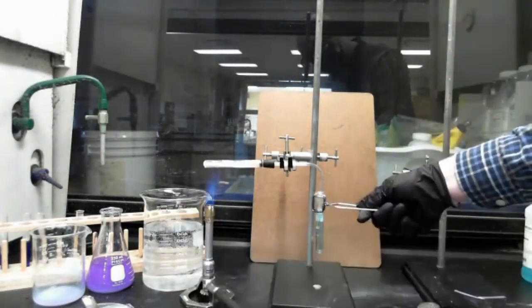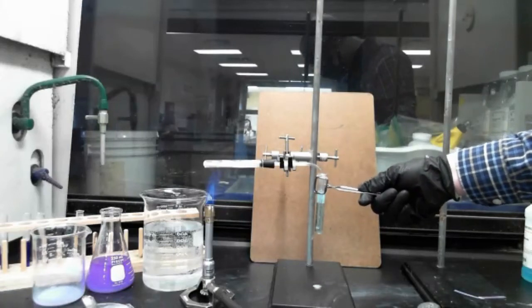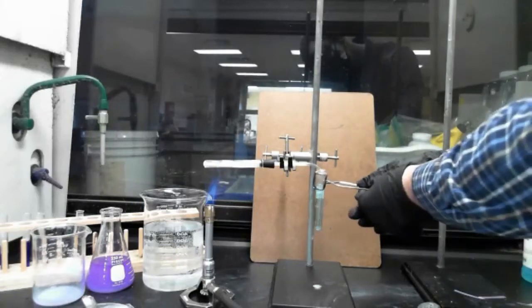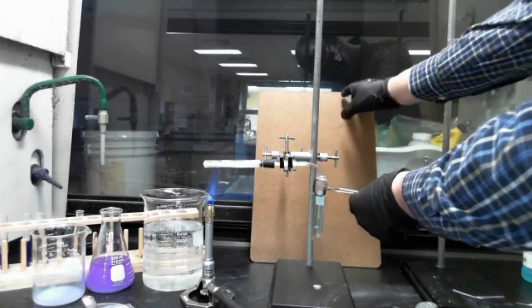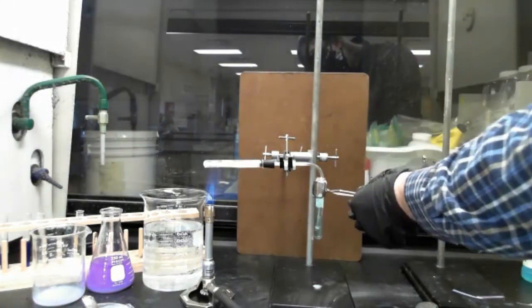So I'm going to get this ready and put this under here and I'm going to start heating that. And you'll notice you start getting bubbles. Let me tip this up so maybe it can wear off a little bit.